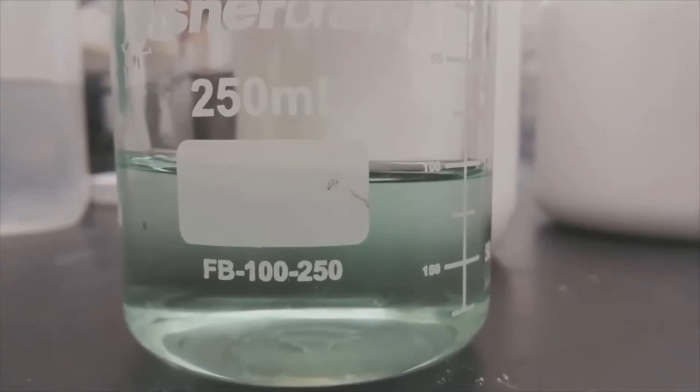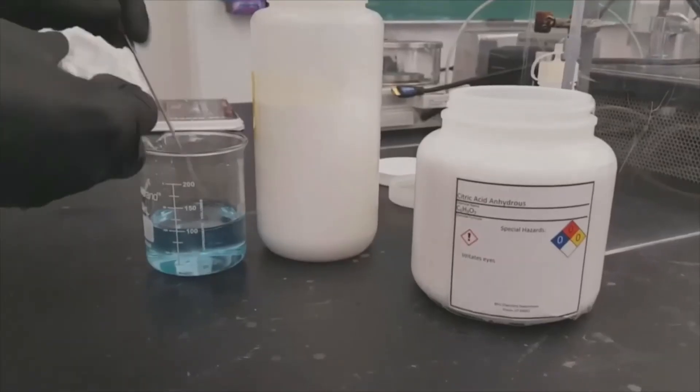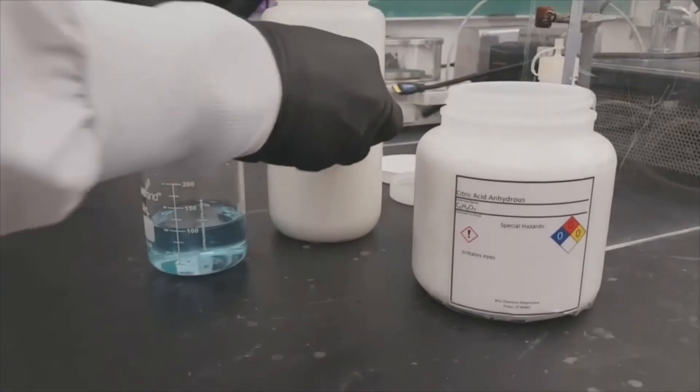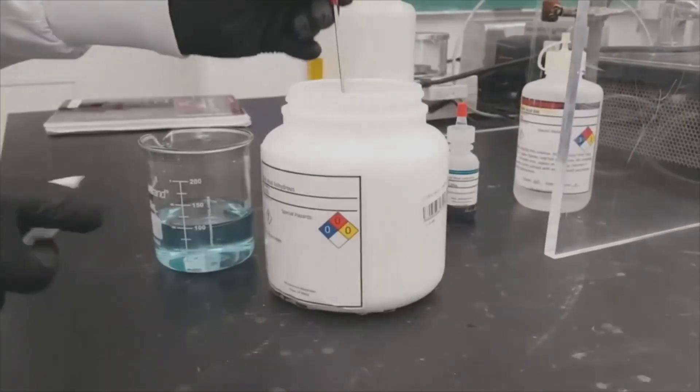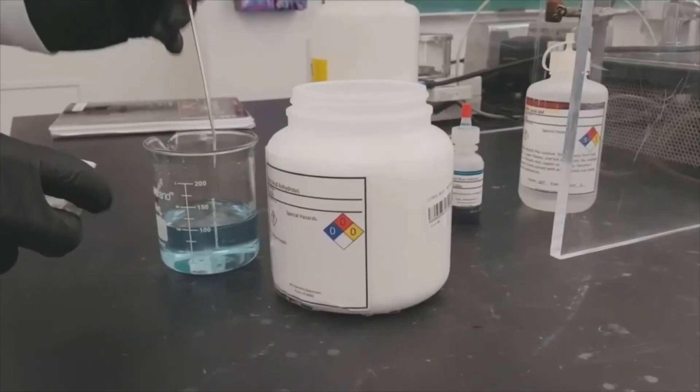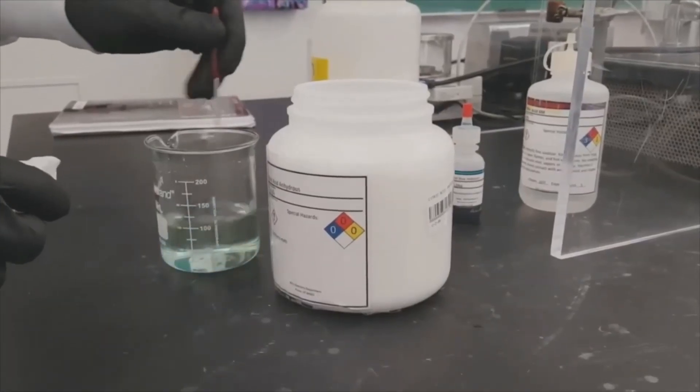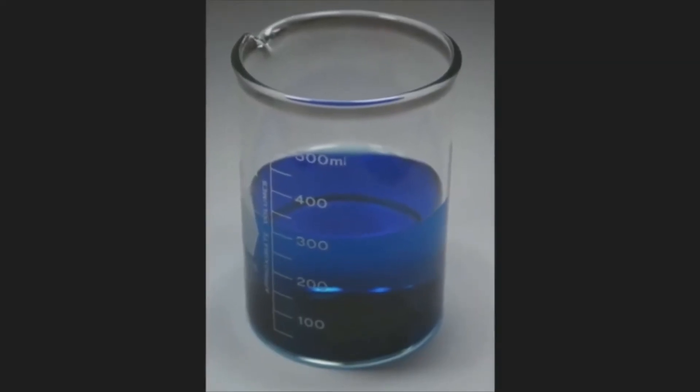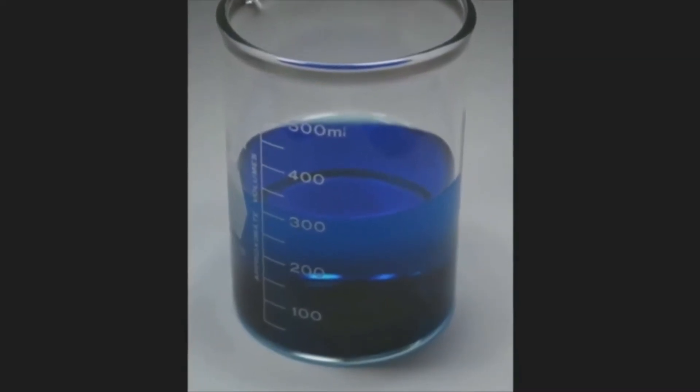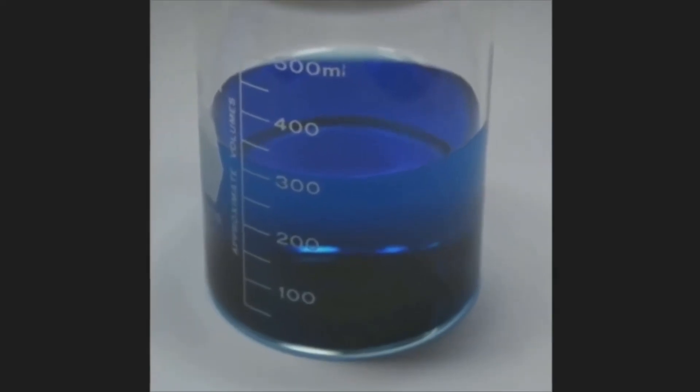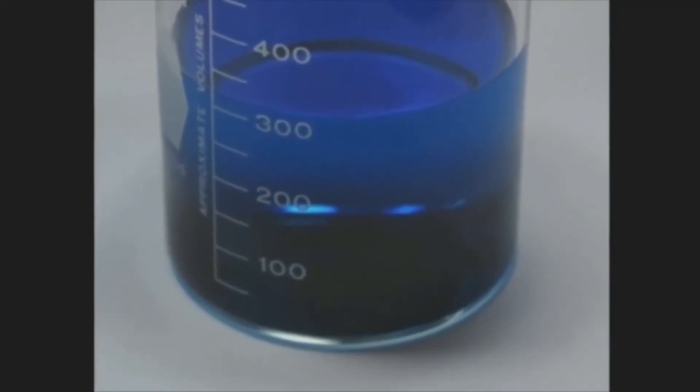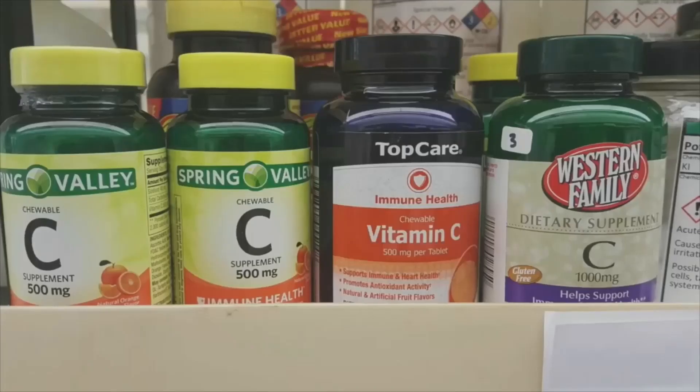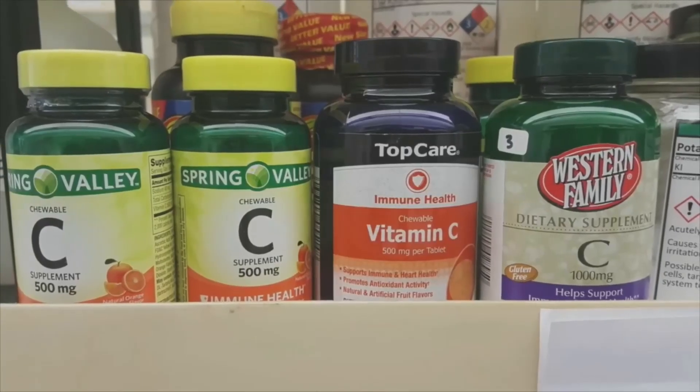If instead the solution is blue because it's basic, you'll want to add citric acid in the same manner just a little bit at a time until it turns green or if it just barely turns yellow then that's okay also. Some of you will have an unknown that will behave badly in this neutralization and it will make something that looks like sludge. This doesn't happen all the time but if it does happen then the stock room can help you.